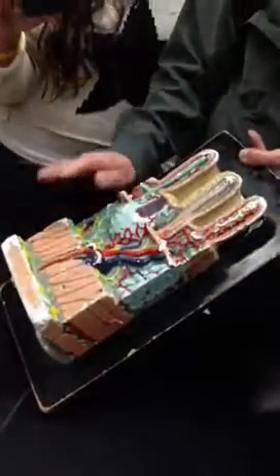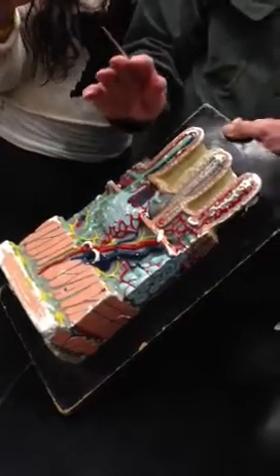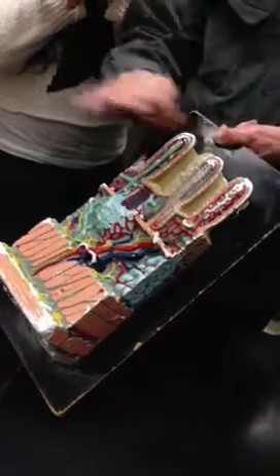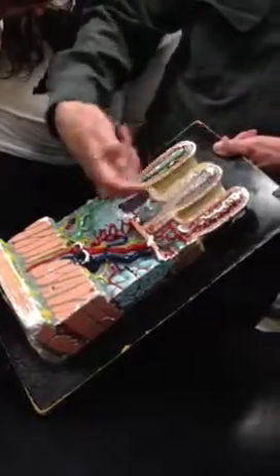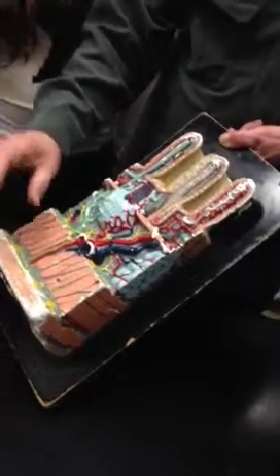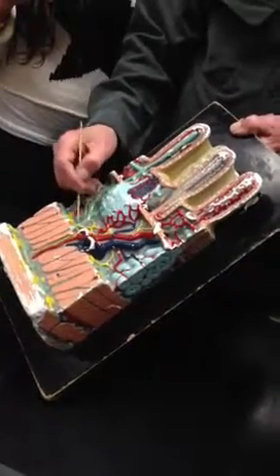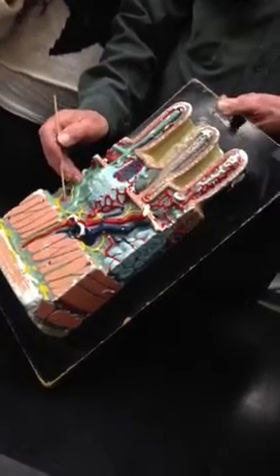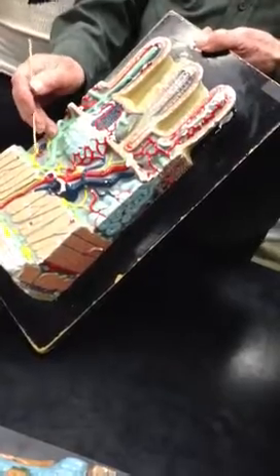All of these yellow things are nerve tissue, okay? They're nervous elements. They're part of the parasympathetic and sympathetic nervous system that controls the peristalsis and the movement of the stomach, the contractions here that move the food along in peristaltic waves. So the thinner elements here are known as Meissner's plexuses, M-E-I-S-S-N-E-R, Meissner's plexus.